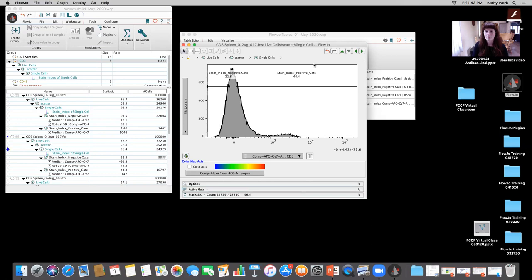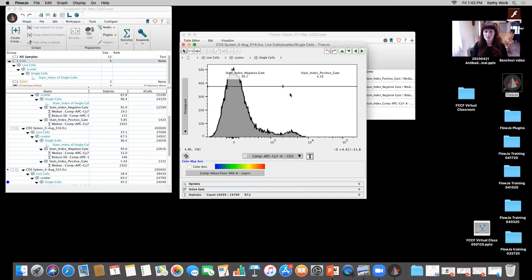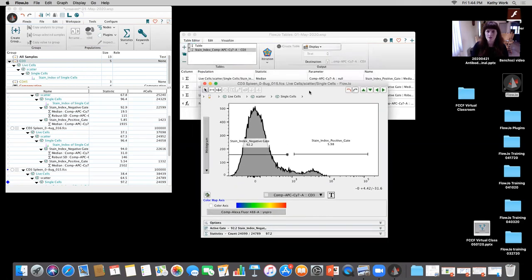I'm going to toggle through, and it automatically sets them all the same spot. I'm going to go ahead and I'm going to adjust them. As I'm doing that, all I have to do is a quick adjustment of those gates. Make sure I'm gating my positive and negative. Now, I don't love using histograms to be able to pull out positive and negative, because when you have a histogram, you have a distribution of the data one way, and you have a distribution of this population the other way. It's going to be a little bit harder to pull out the positive and the negative, but to show you how this plugin works and how you get the stain index in this way, it's sufficient for today.